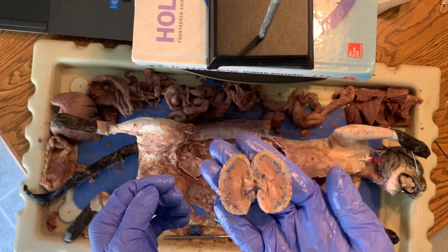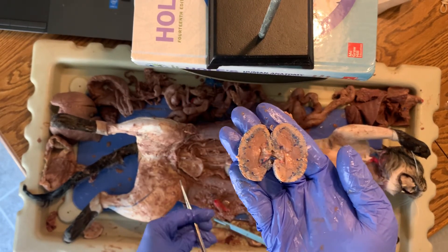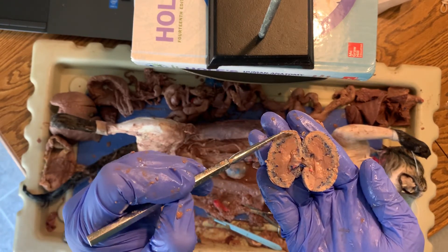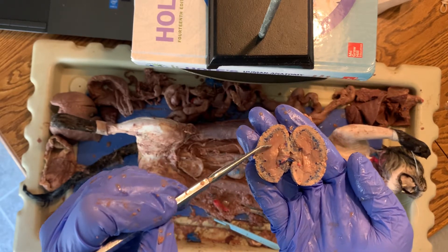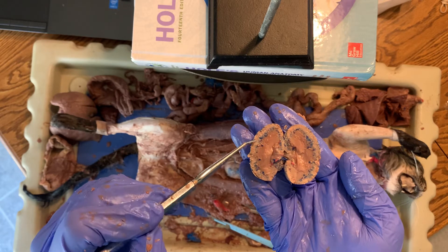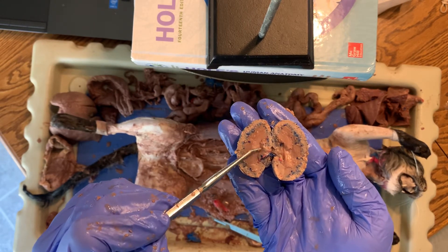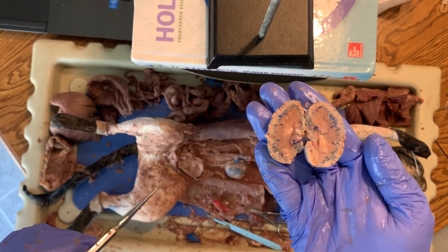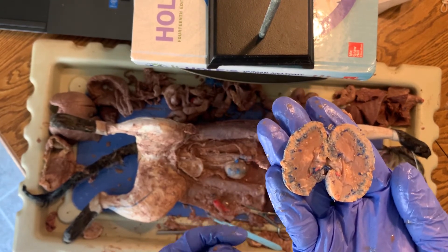You can see that the kidney has distinct layers to it. The cortex is the outermost portion, and then we have the medulla which is in the middle. This is where you can find those renal pyramids — that's where all those nephrons are. They start up here and then end down here, and then they drain down into the pelvis and eventually the sinus, and then eventually leave out the ureter. That's the inside of a kidney.